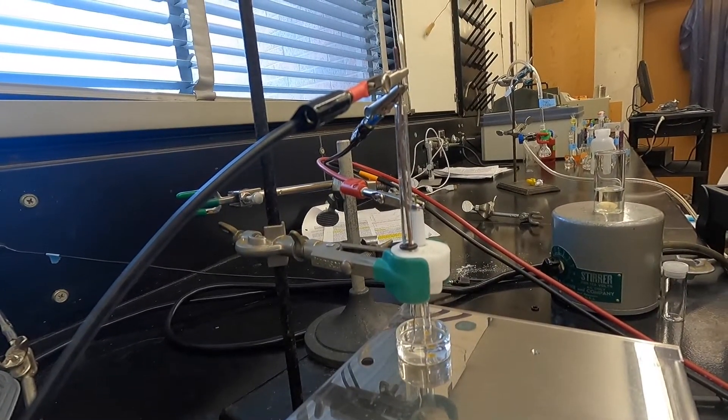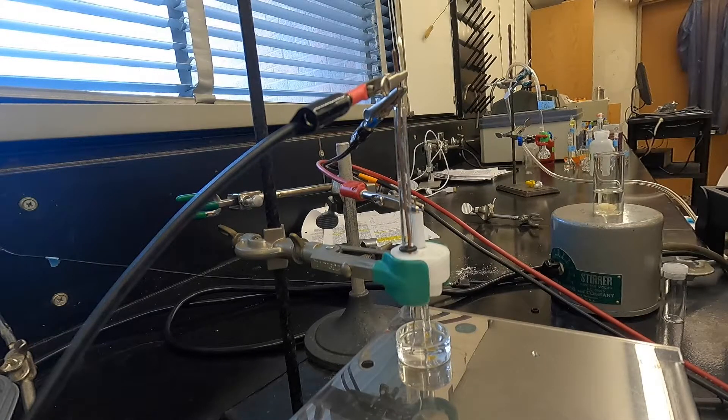Here's a shot of the whole cell setup just so you can see what it looks like. Make sure nothing's shorted.